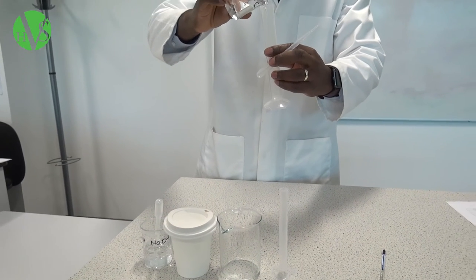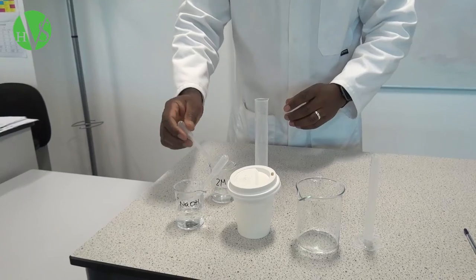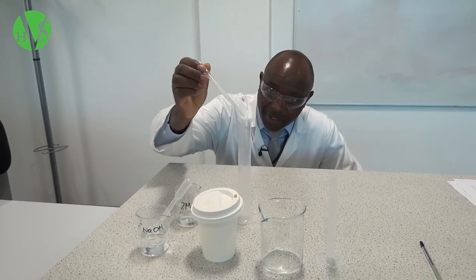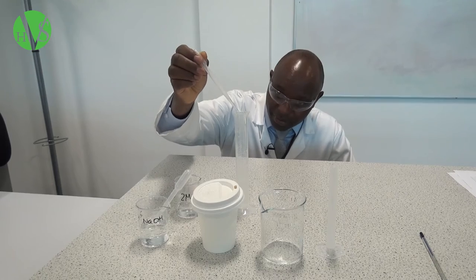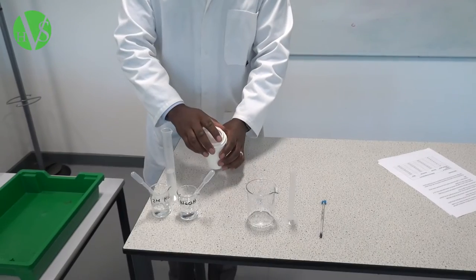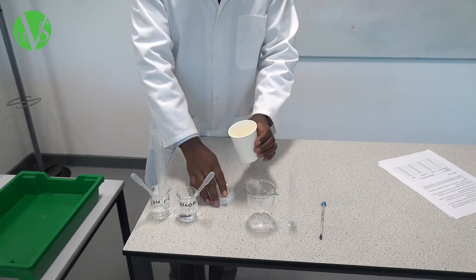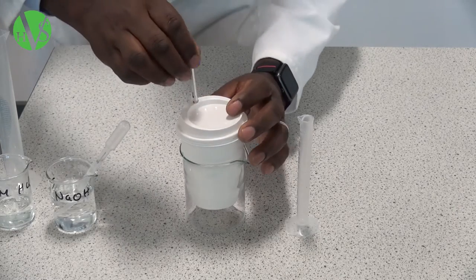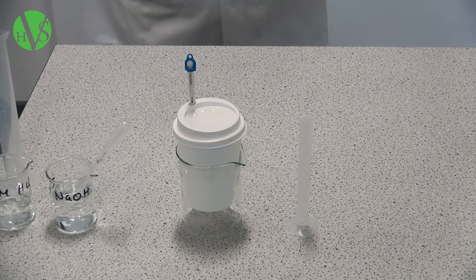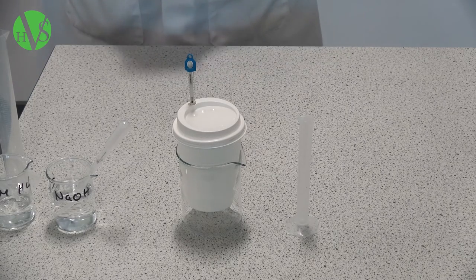Using a 50 ml measuring cylinder, we're going to measure 30 cm³ of hydrochloric acid. We can use the pipette just to make sure that we are accurate in getting the correct amount, and we should read the lower side of the meniscus to ensure accuracy. We then put that into our polystyrene cup, replace the lid, and put the cup in the beaker to make it more stable so that it doesn't tip over. The temperature of the hydrochloric acid inside the cup is 22 degrees Celsius, and we need to record that in our table.